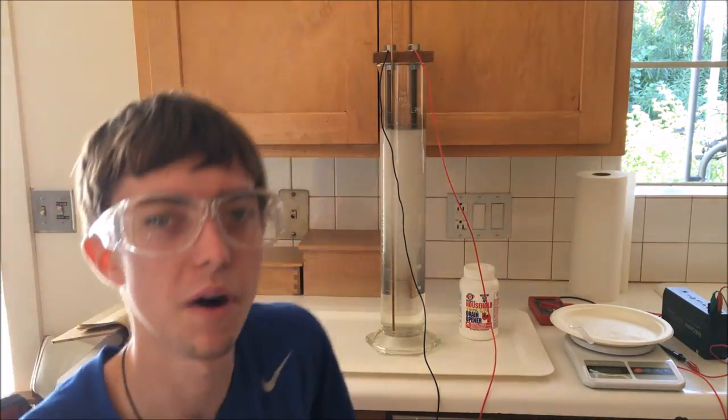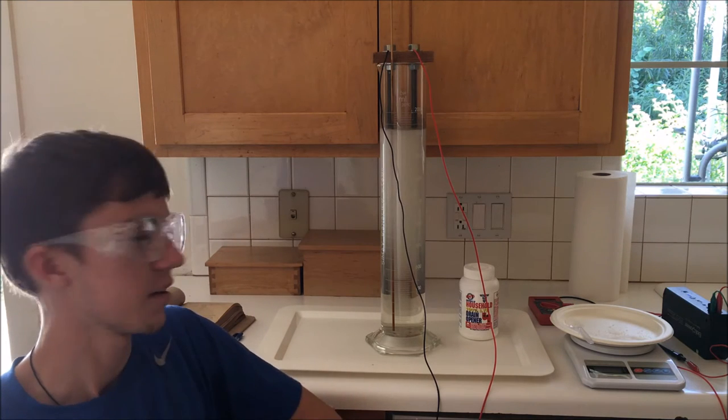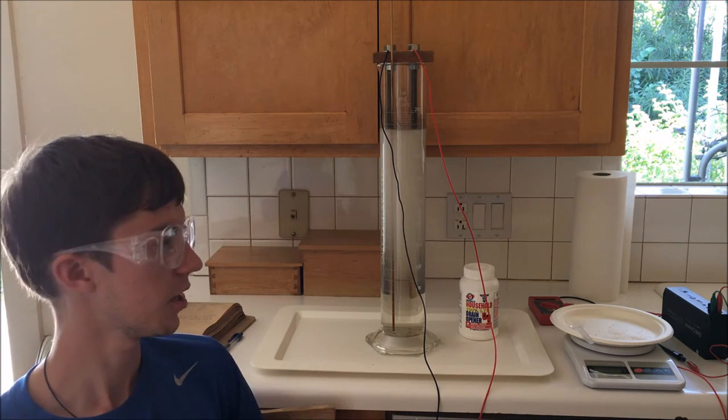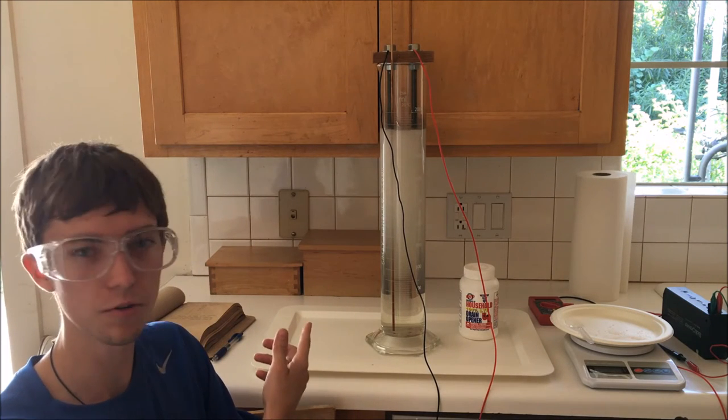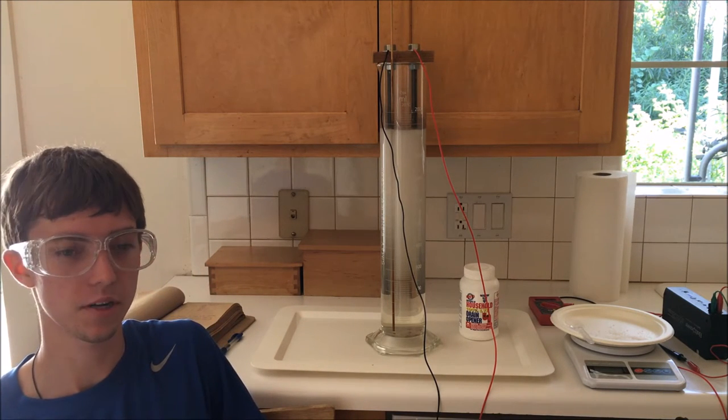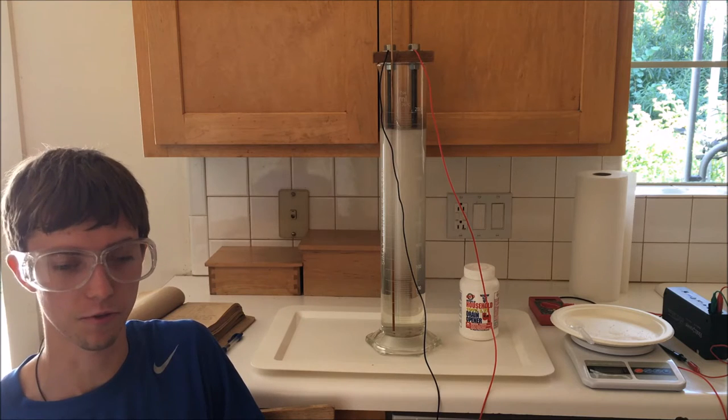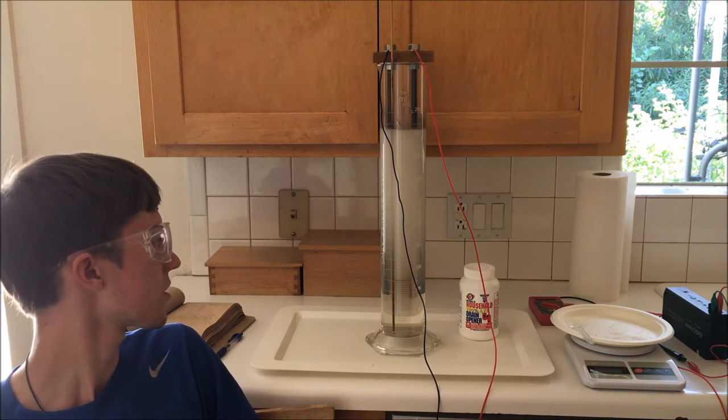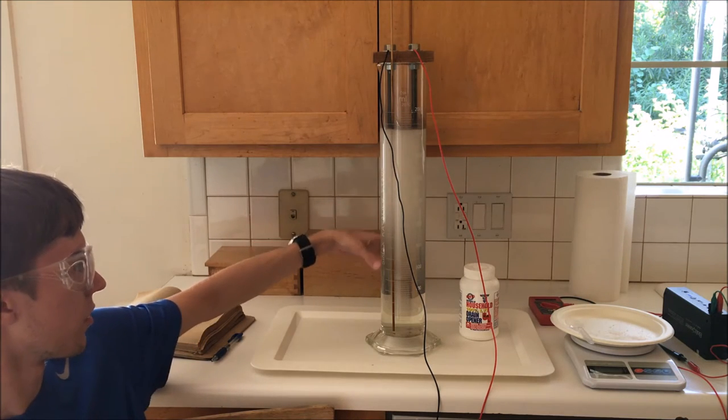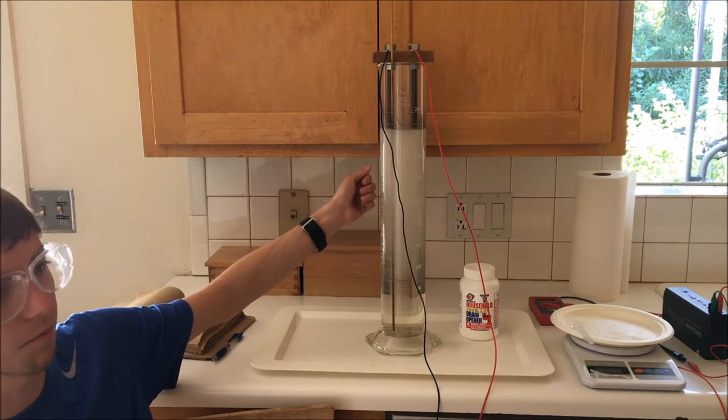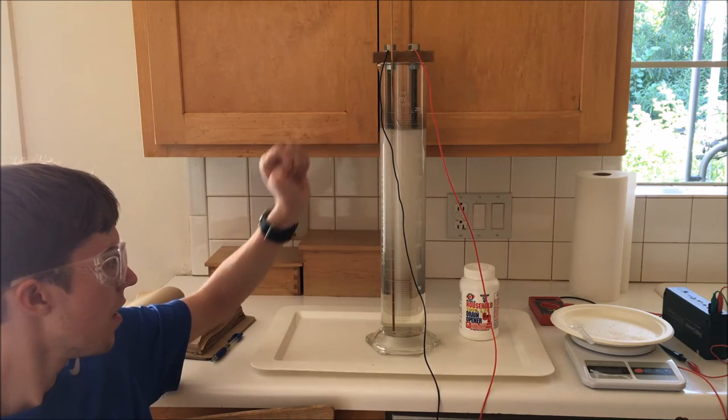As you can see, it's now bubbling away. I actually brought the concentration up such that it would draw about 5 amps, and it was reacting so vigorously that I decided to drop my target amperage from 10 amps down to 5 instead. I think that's going to be evolving plenty of gas to consume most of this water within a relatively short period of maybe a few days at a time.